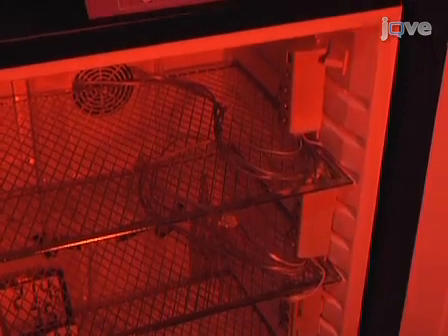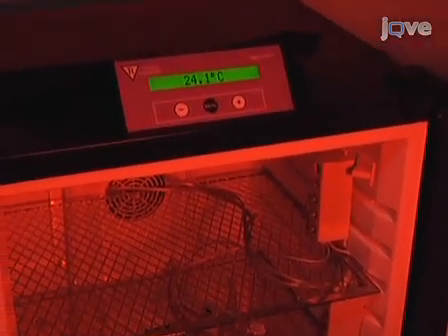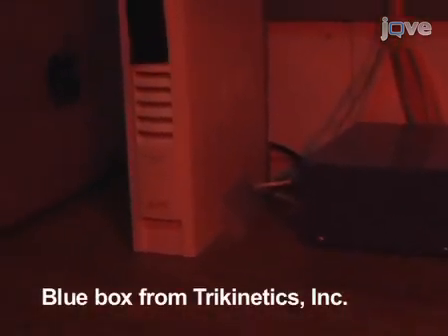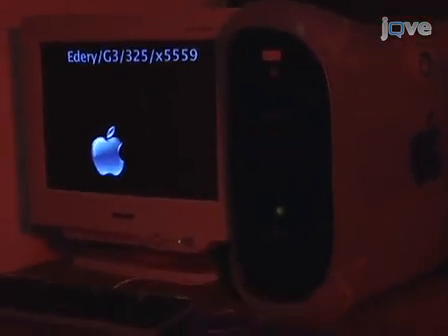Manually arrange the telephone line network neatly around the shelving of the environmentally controlled incubators to allow ease of plugging and unplugging of activity monitors. Set up multiple telephone lines in a way such that they will converge into one main line and extend out of the incubator to connect to the computer. Connect the monitoring devices inside the incubators to the computer via a power supply interface unit, which serves to power the activity monitor via the telephone line.